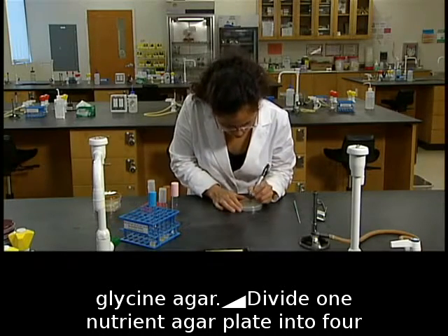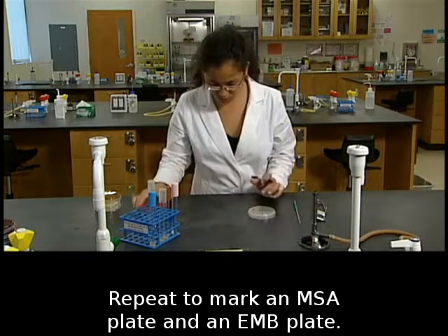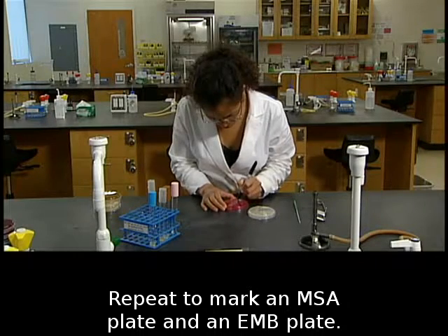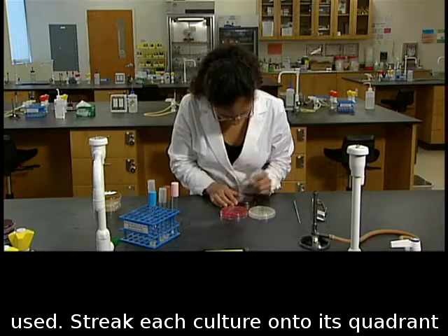Divide one nutrient agar plate into 4 sections by labeling the bottom. Repeat to mark an MSA plate and an EMB plate. Label one quadrant on each plate for the organisms used.